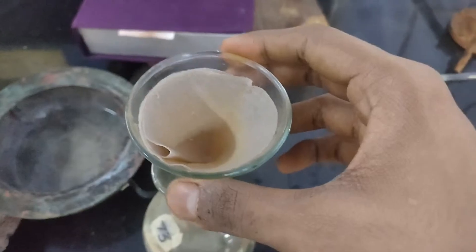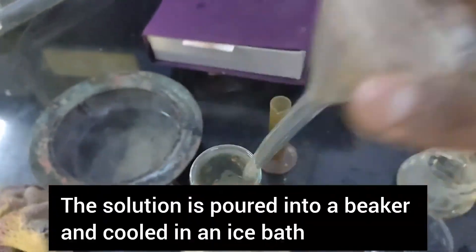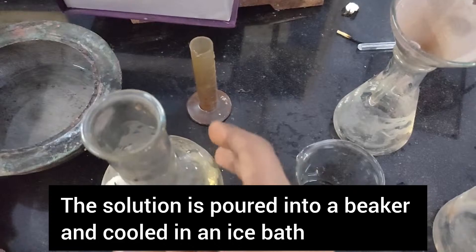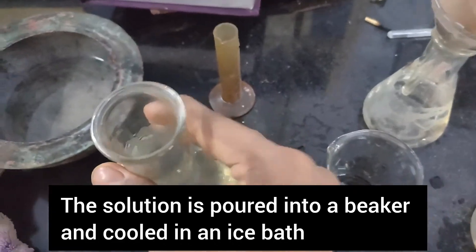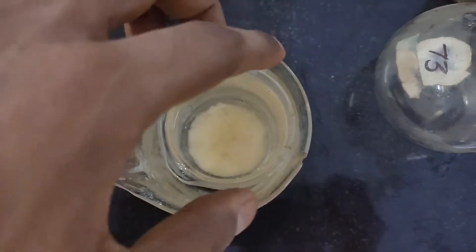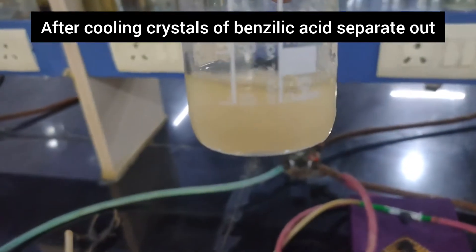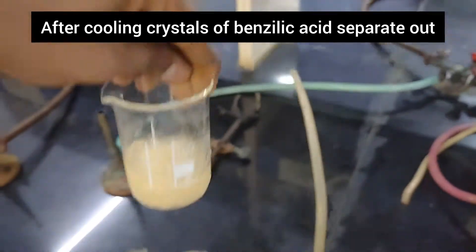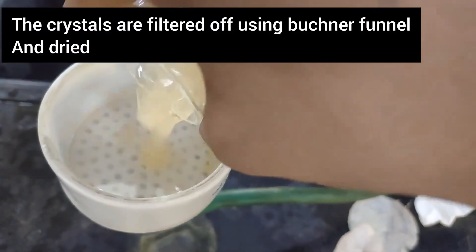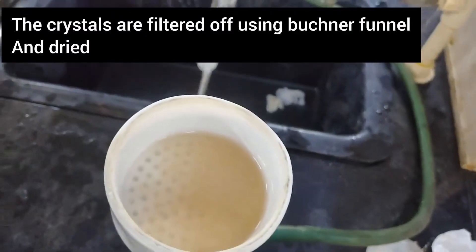The clear solution was allowed to stand at room temperature in a beaker. After cooling to room temperature, the beaker was transferred into an ice bath. On cooling, crystals of benzilic acid separate out. The crystals were filtered off using a Buchner funnel.